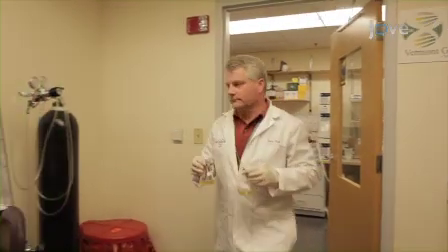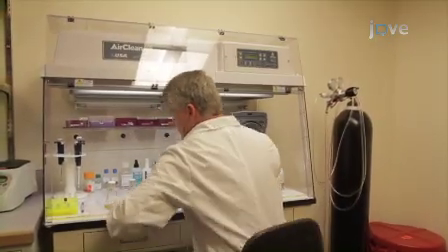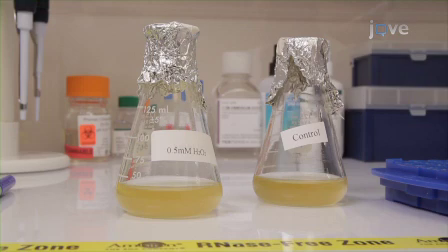To examine the expression differences in yeast undergoing oxidative stress, total RNA is first extracted from 2 yeast cultures by enzymatic lysis. One culture was exposed to oxidative stress by a 1-hour treatment with 0.5 millimolar hydrogen peroxide in Hanks buffered saline, while the other culture was treated with only HBSS as a control.